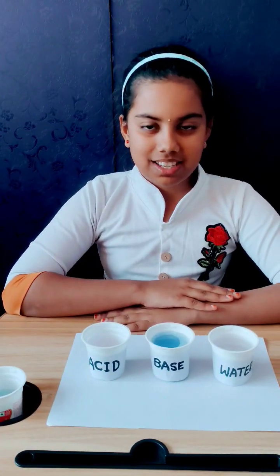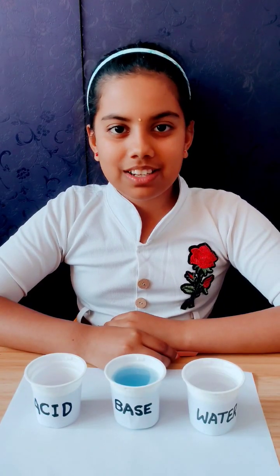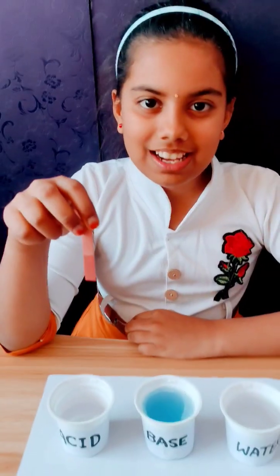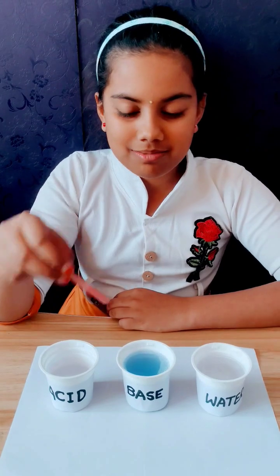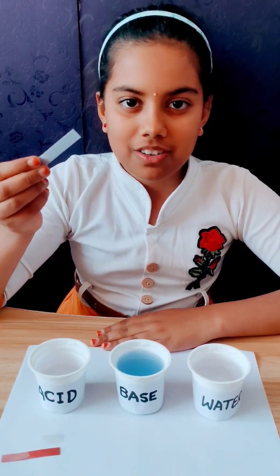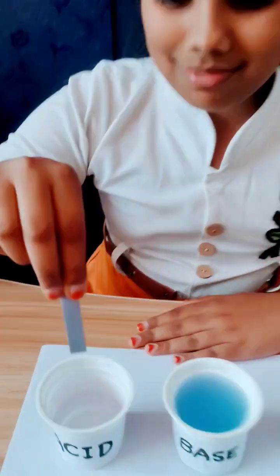Now I am taking acid. Now I am testing acid with litmus paper. Now I am taking red color litmus paper. Red color litmus paper cannot change color in acid. Now I am taking blue litmus paper. If we dip blue litmus paper into acid, it will turn into red color.